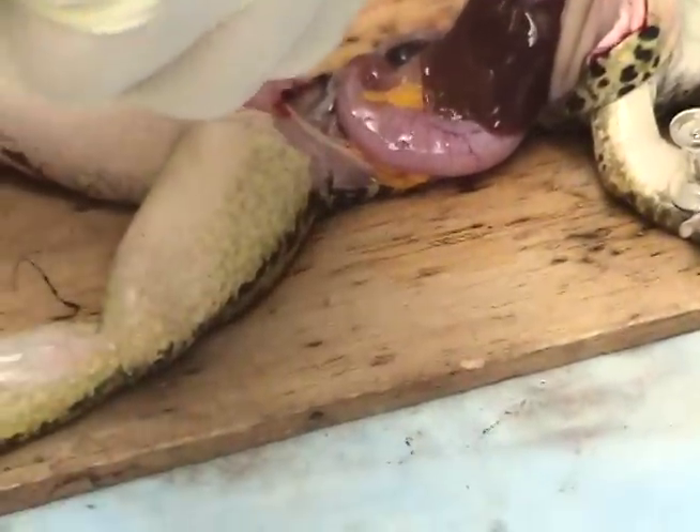Those brown are the lungs, right? This? Yeah. This is the liver. Oh, that's right. So the other part is — oh, the lung is down there. Yeah.